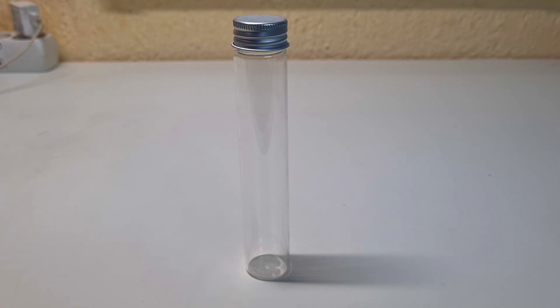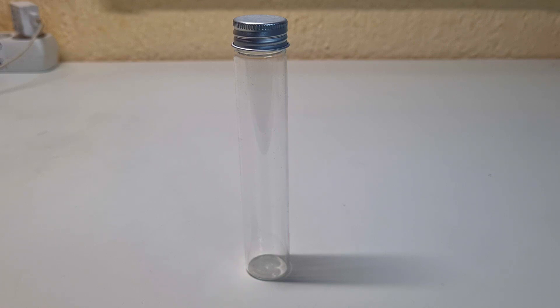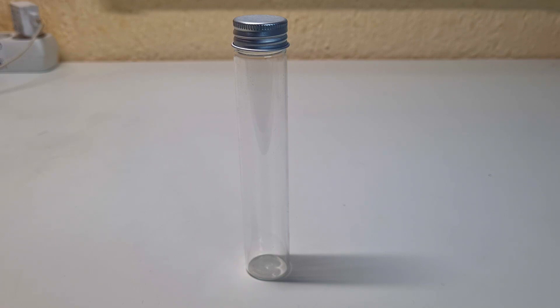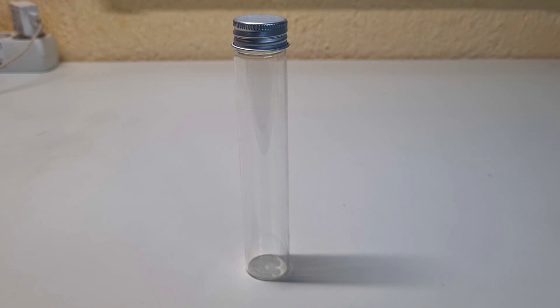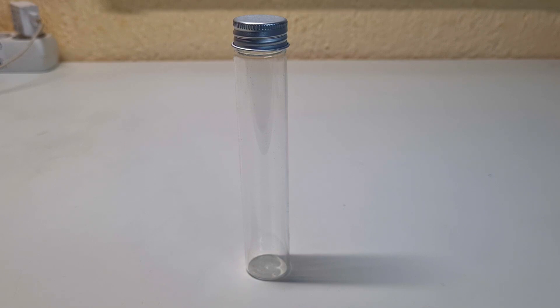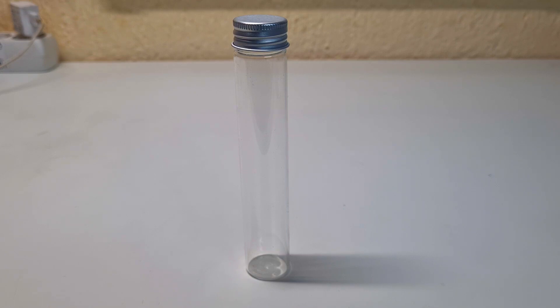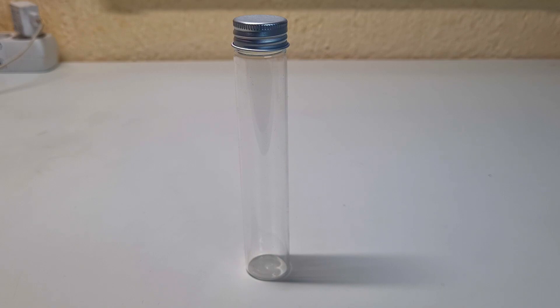In this video I will make some short experiment with iodine and activated carbon. I will show you how good the activated carbon will absorb the iodine.